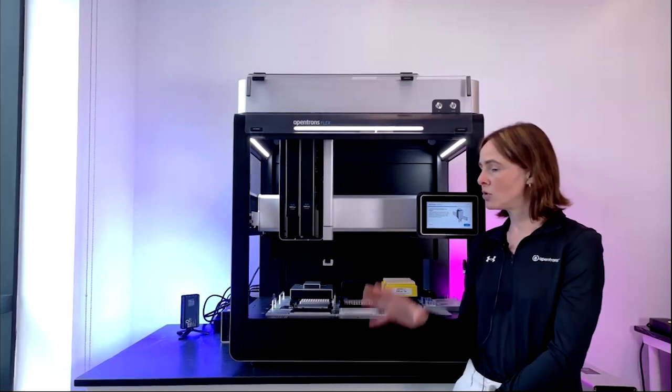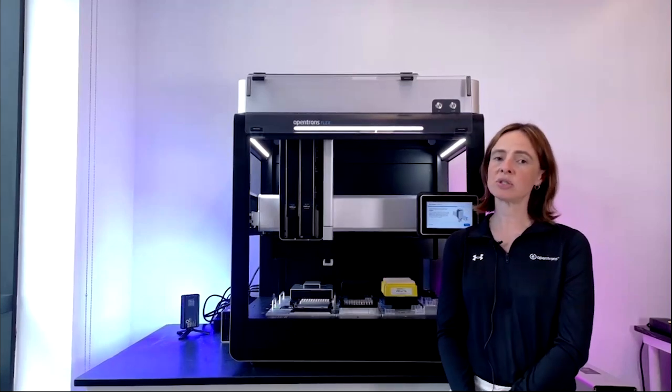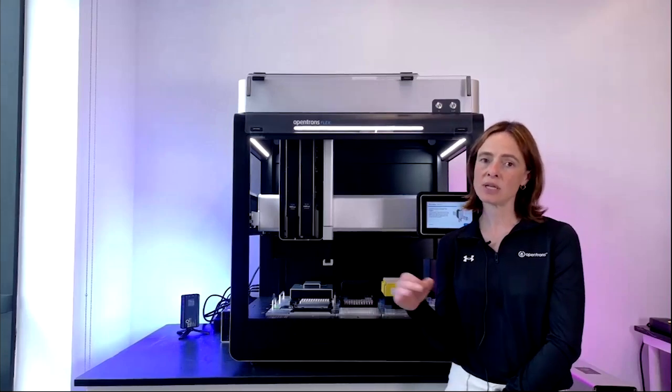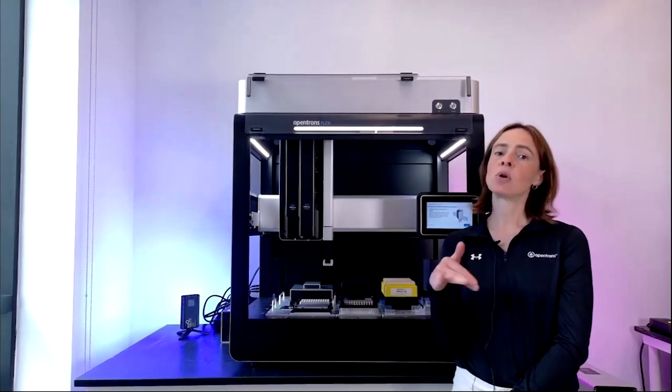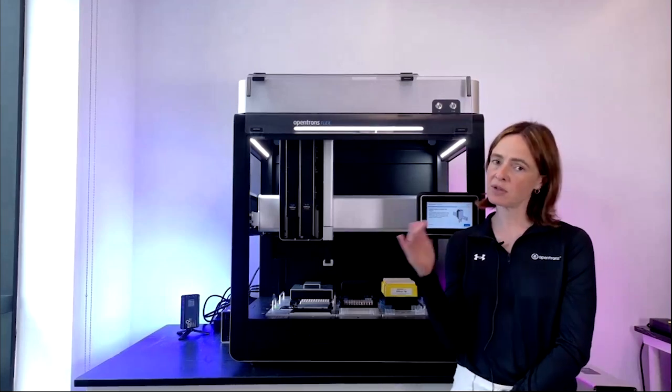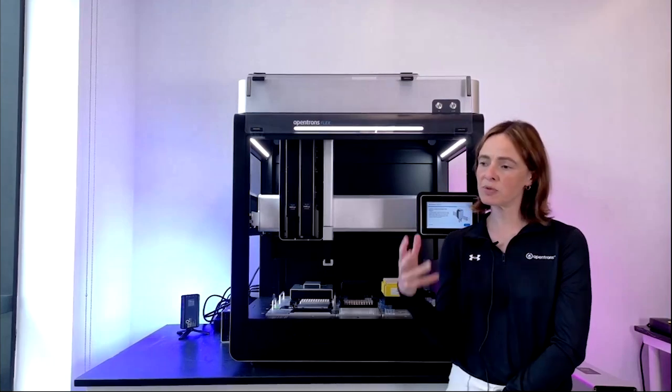With the 96 channel, you can obviously pipette 96 samples all at once, but you can also do something called partial tip pickup, which allows the 96 channel to pick up either 1 tip, 1 row of tips, 1 column of tips, and in the future, several rows or columns. So in that regard, you can really use the 96 to provide a whole bunch of different ways to pipette things around the deck.